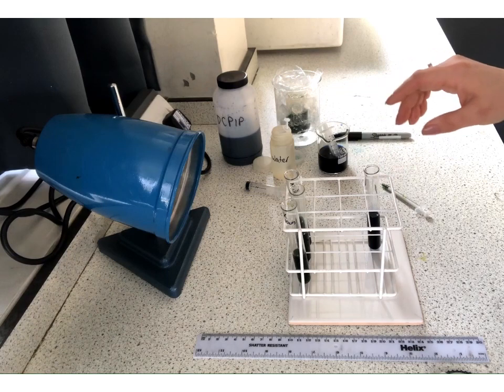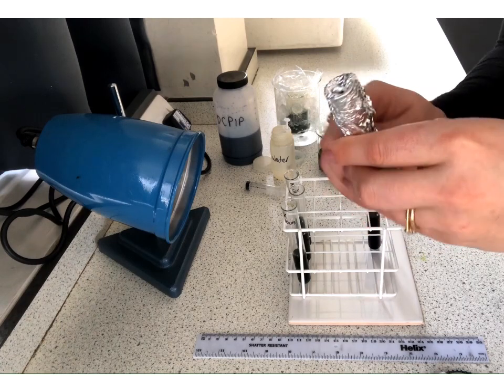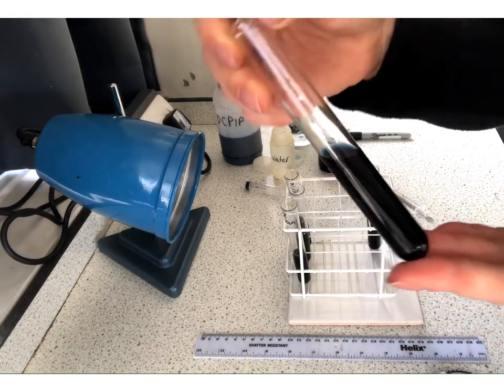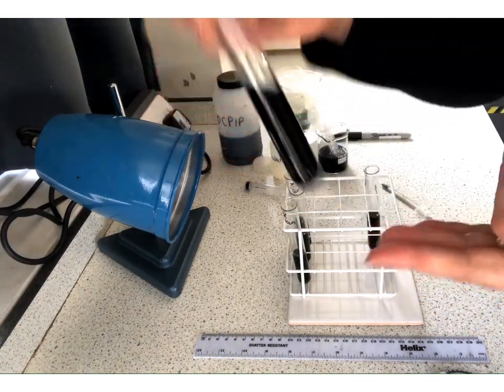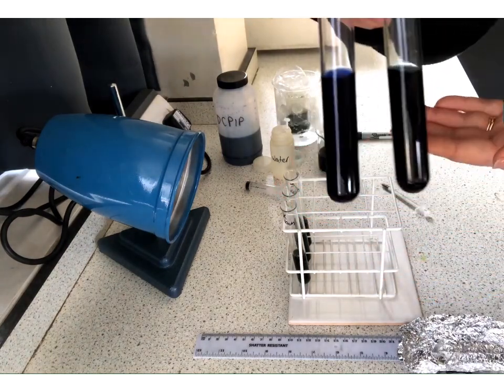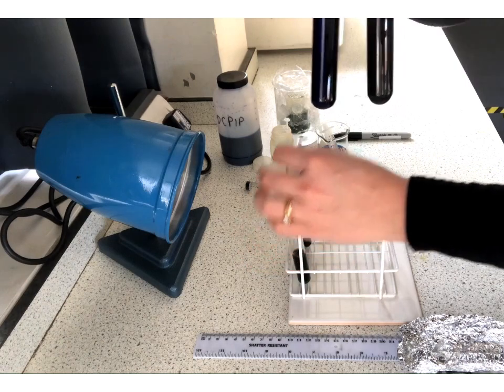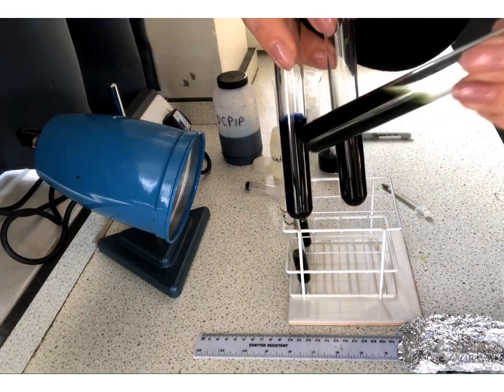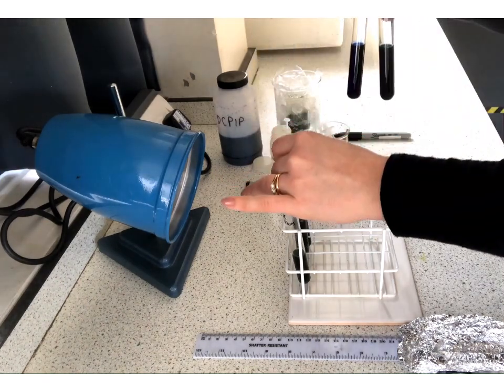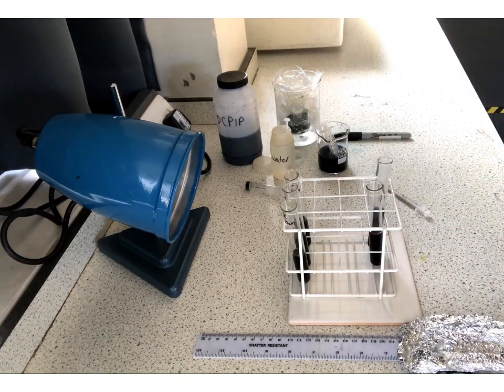And then this one, hopefully, I've managed to wrap it up effectively. This is to show that it was the light that was causing the change. And yes, so this is still a lovely blue colour. So without light, it also did not change. Okay, so you've got your variation there. We've got with chloroplasts, but without the light. We've got no chloroplasts, and then we've got a lovely green sample, which has got the chloroplasts and was exposed to the light. Okay, so that confirms our results. And hopefully that's all made sense and you've been able to follow through with it.